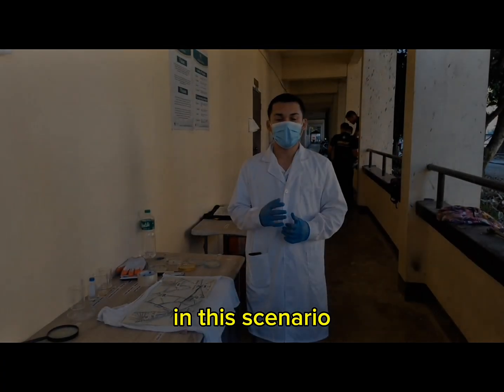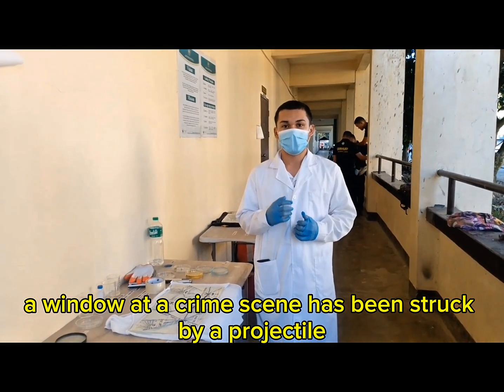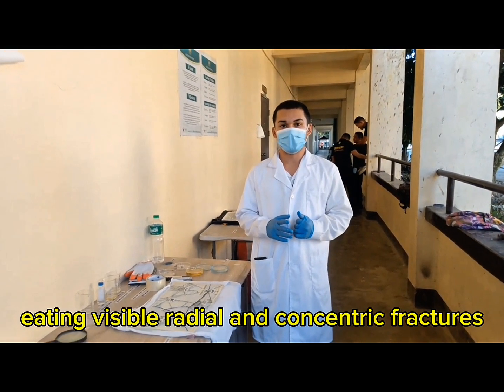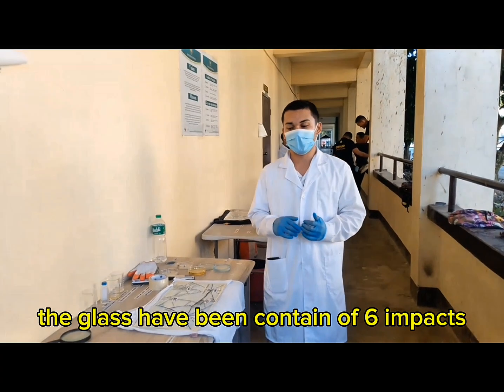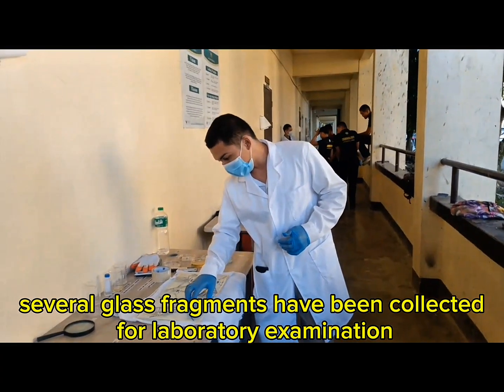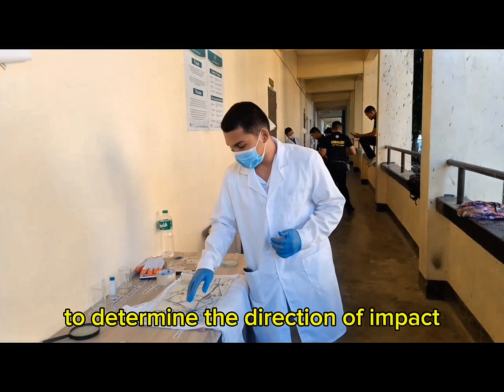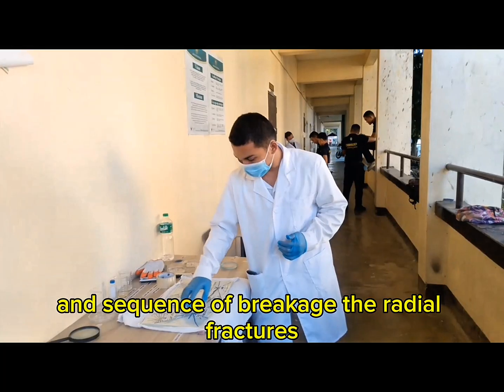In this scenario, a window at a crime scene has been struck by a projectile, creating visible radial and concentric fractures. The glass contained 6 impacts. Several glass fragments have been collected for laboratory examination to determine the direction of impact and sequence of breakage.